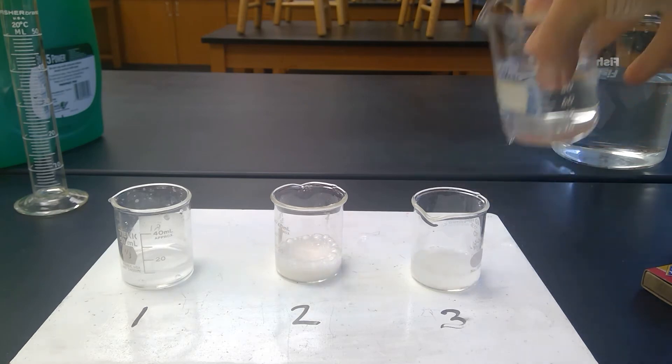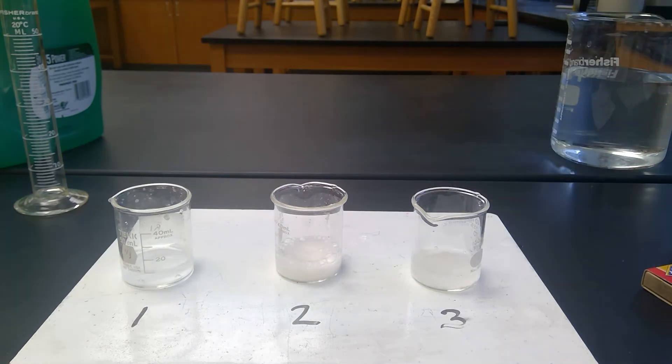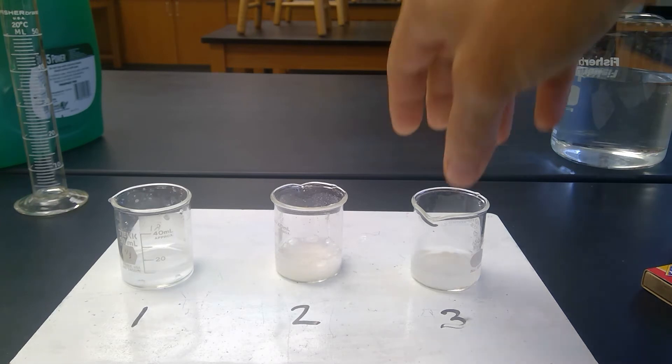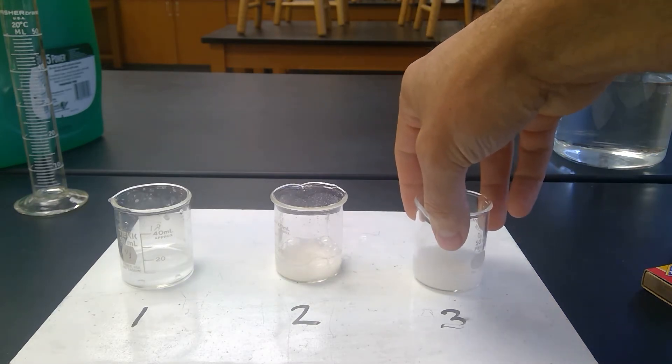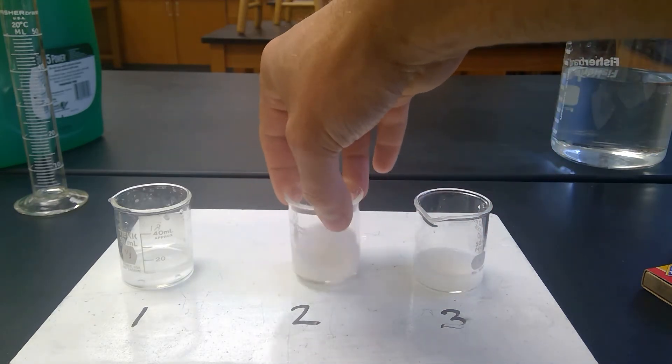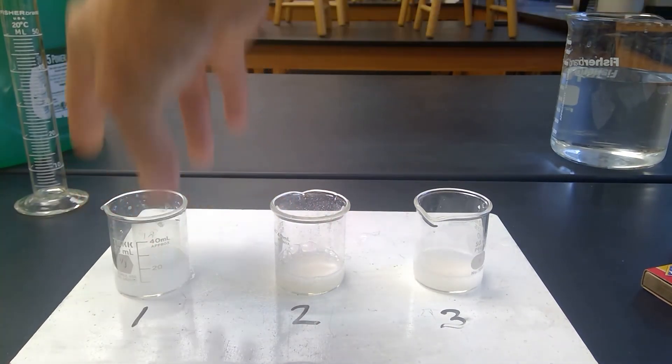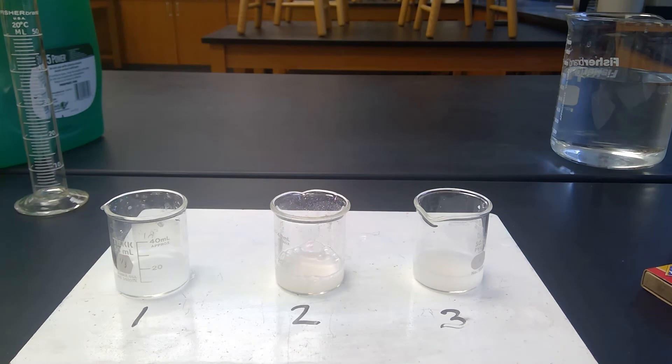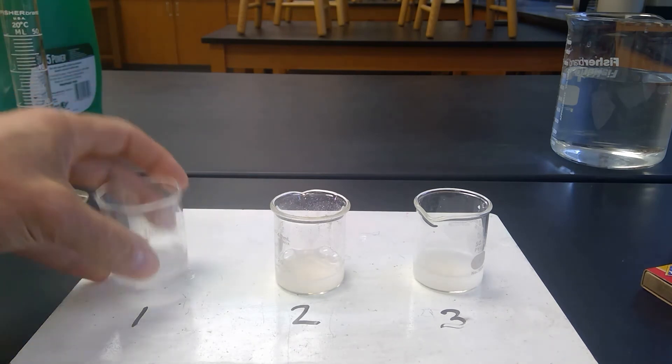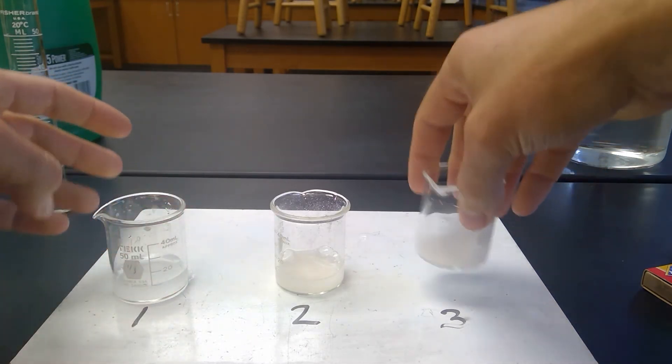And what you hear right away is in that middle one, fizzing. So clearly that's an observation that we can make, that a chemical reaction of some sort is happening between the two that are mixed. The ones that are by themselves, nothing.